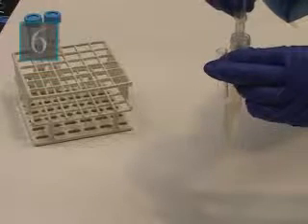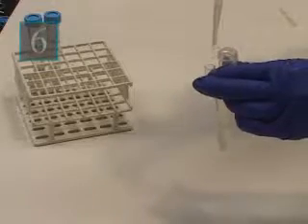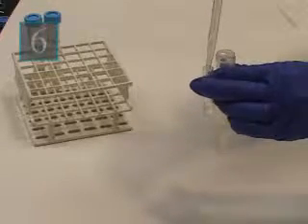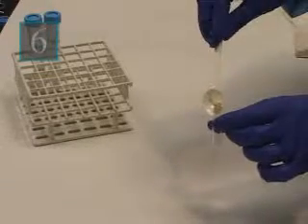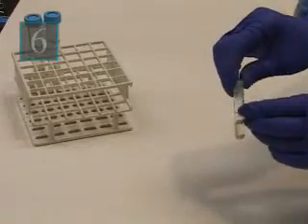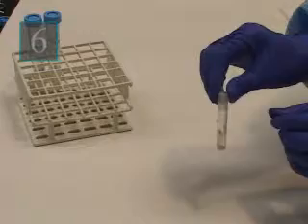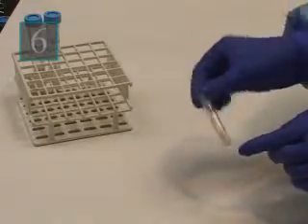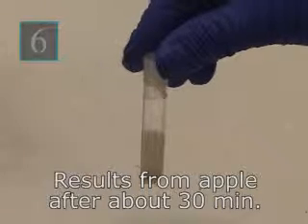E. Use a transfer pipette to remove the supernatant or liquid part to a small test tube. Label the tube. F. Repeat steps A through E for 2 additional fruits or vegetables. G. Repeat step 3 to test for sucrose. Which of the test tubes produced bubbles?